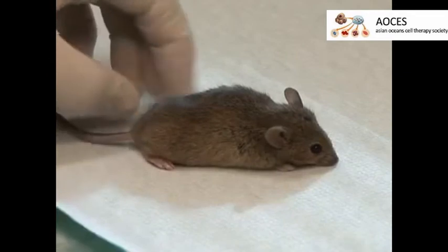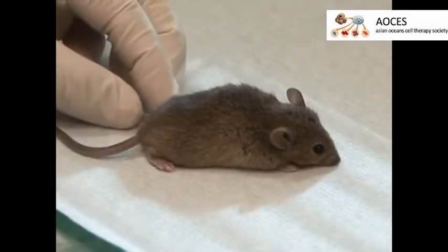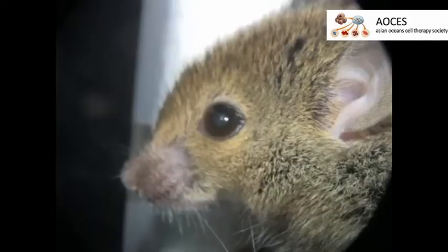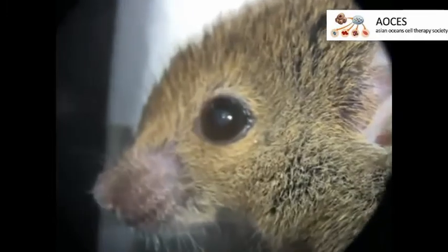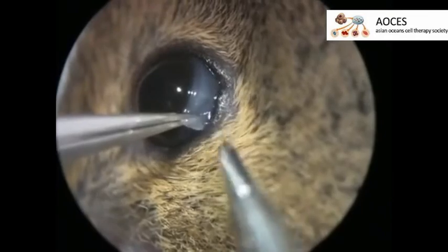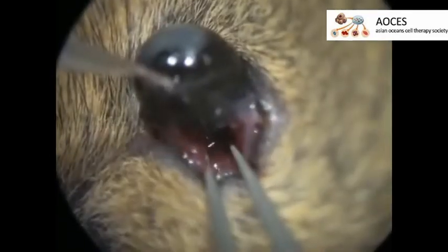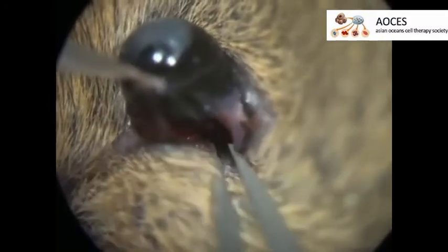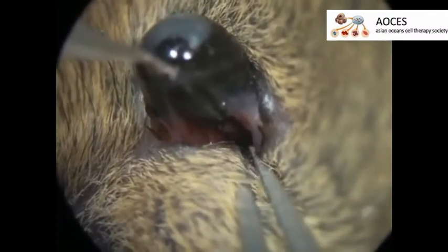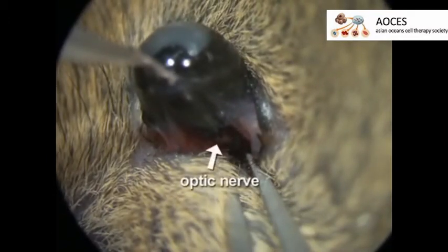Three days after the tracer dye injection, the mouse is deeply anesthetized with an approved anesthetic. Place the mouse under the dissecting microscope and center the mouse to visualize the eye. Use a pair of spring scissors to incise the conjunctiva of the left eye at the 4 o'clock position. Next, gently dissect the orbital muscles and move them to one side. Taking care not to damage any blood vessels, expose the white optic nerve at the level of its exit from the eye globe.